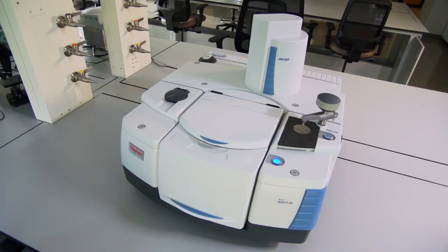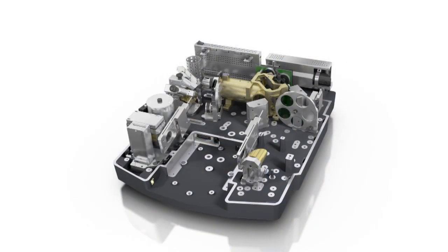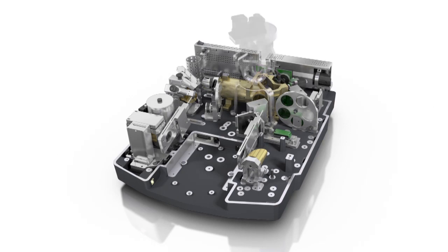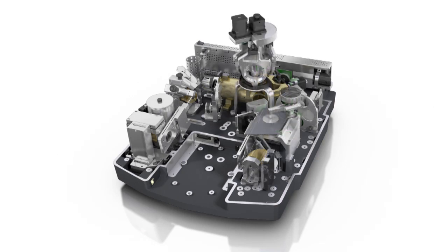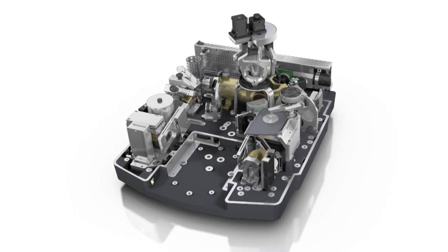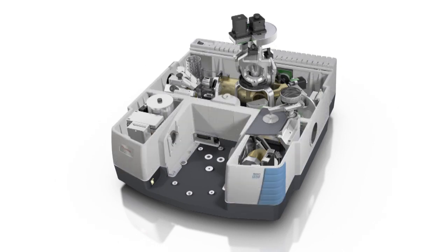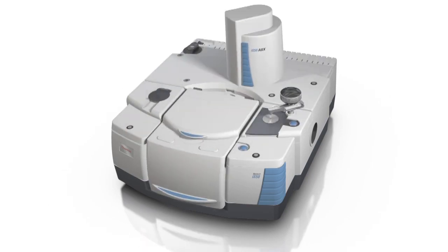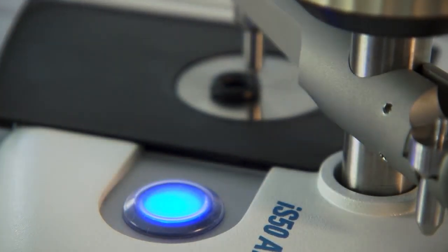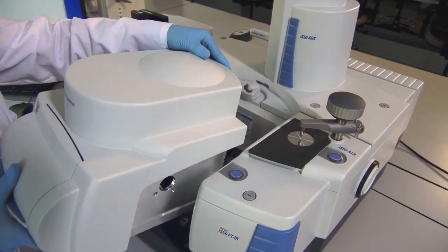Inside the Nicolet IS-50 FTIR spectrometer, all your infrared optics are coordinated to configure the system at the press of a button. The automatic beam splitter exchanger positions multi-range optics that enable mid-IR analysis in the fingerprint region, far IR for inorganics, and near IR for verification or method development, all with exclusive touchpoint operation.